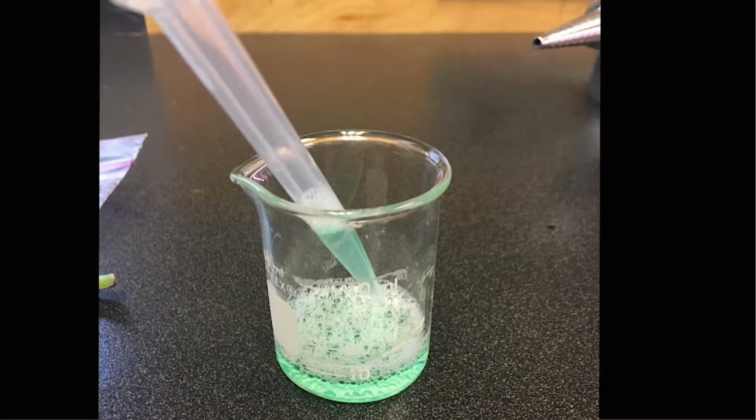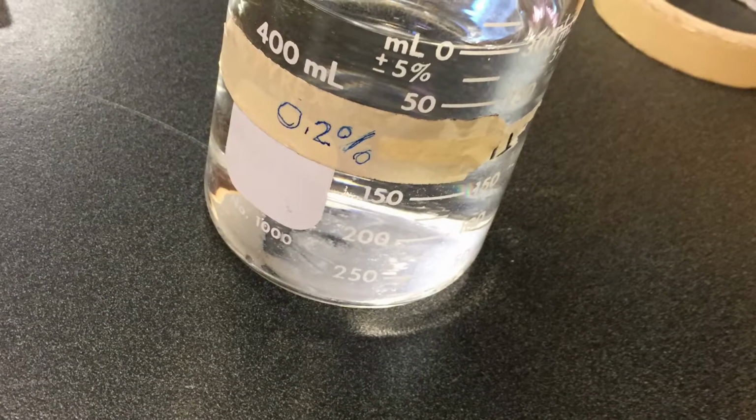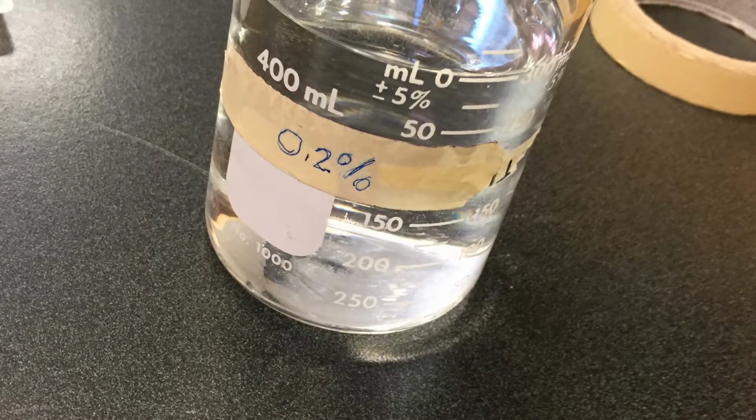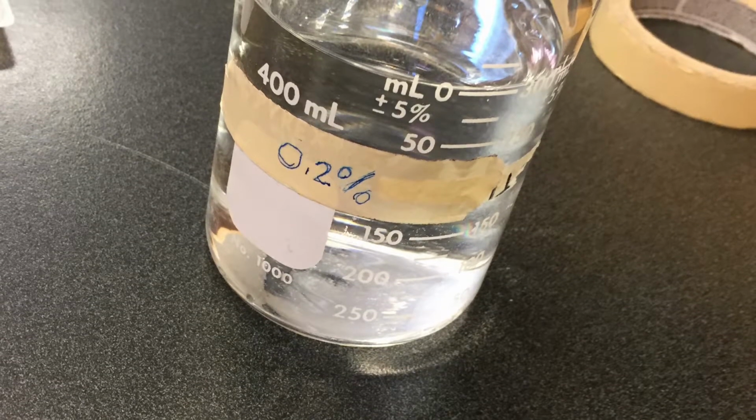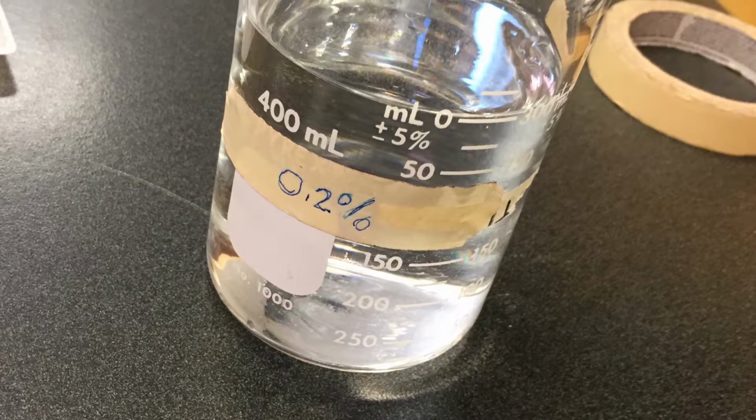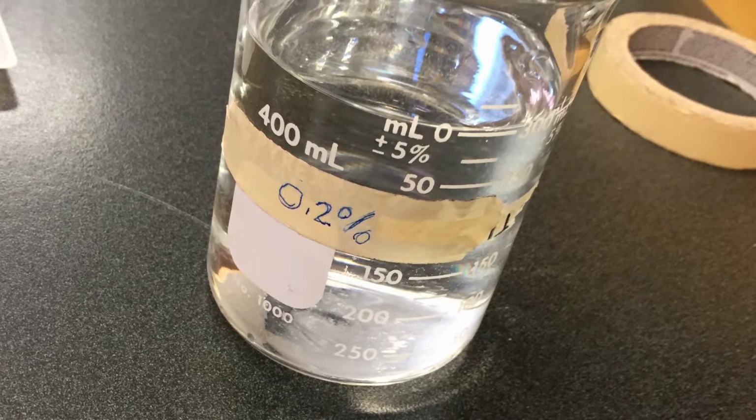We'll start with creating a liquid dish soap solution by combining 5 drops of liquid dish soap and 5 drops of water. Next, we will be preparing the 0.2% solution of sodium bicarbonate by placing 1.39 grams of baking soda into 300 milliliters of water. In addition to that, we'll be adding 1 drop of diluted liquid dish soap.